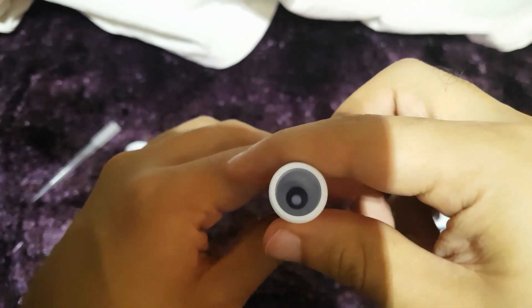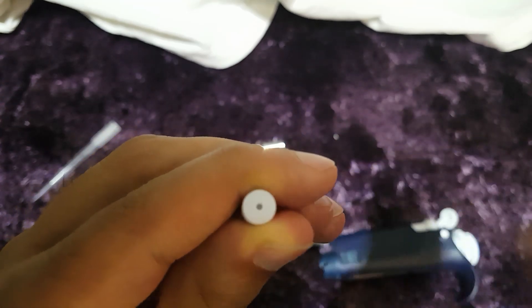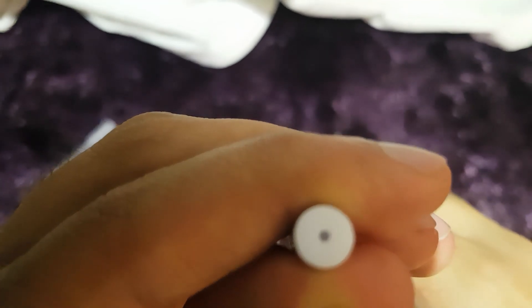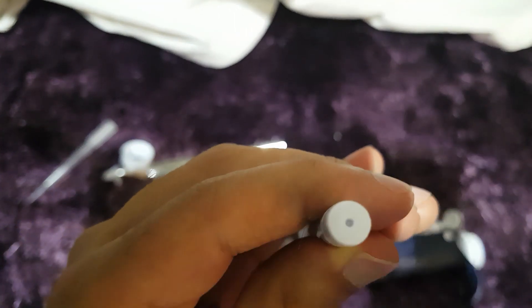Just give me a moment whilst I blow some air through this. I was unable to blow air through this, so it means that there's something blocked in there. What we have to do is try and unblock that. If we have a look, we can see we can't see right through — the reason being that there's something stuck in there.